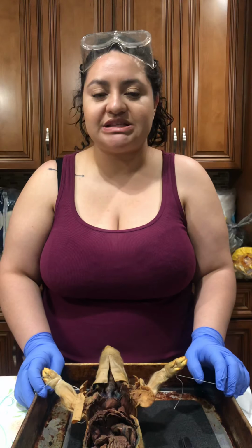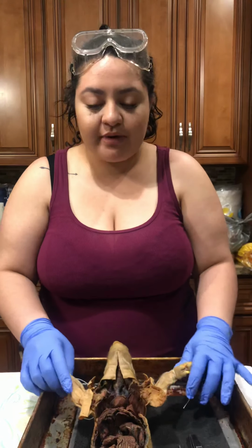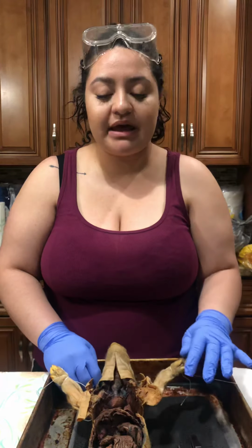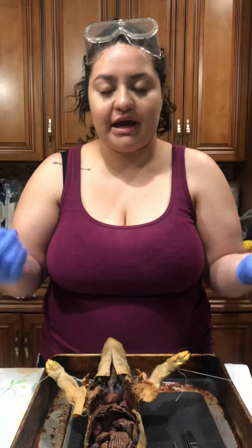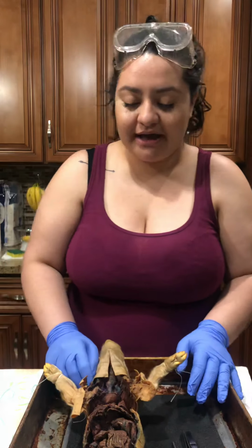Today's date is June 22nd, 2019, and this week is week 7 lab video regarding the anatomy of the urinary system of the fetal pig. So I'll be going over 8 particular structures of the pig, and I just want to let you know that I'm not wearing my goggles because it fogs up when I try to look at the sites, and I'm not wearing my mask either so I can talk clearly, okay?